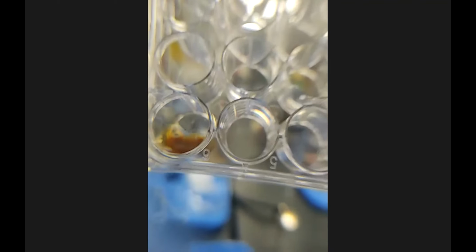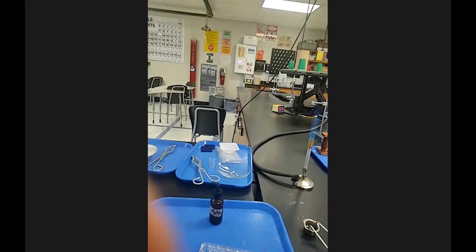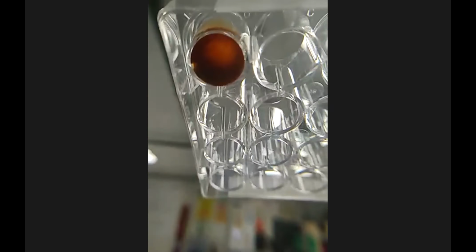All right, so we have an orangey brown color. You can see some of the residue off to the right side of the well versus more of it on the left. Just trying to show you guys from different views. Let me tilt up my phone so you can see the bottom a little bit easier. So that's the bottom view of it. And I'll let it sit for a little bit and then show you again.